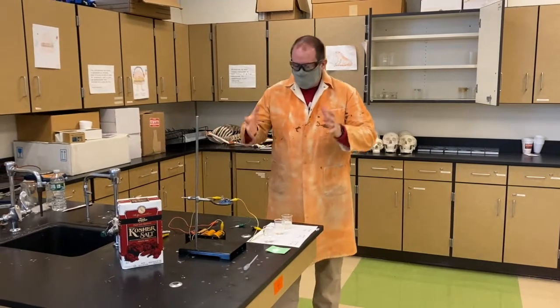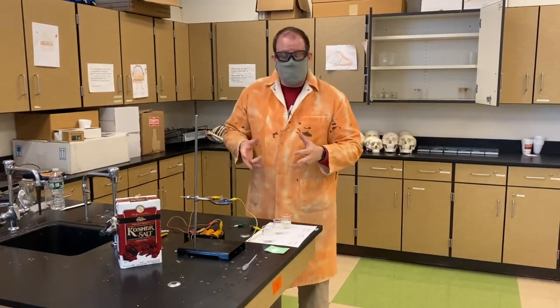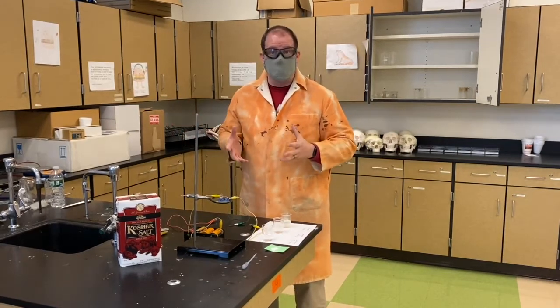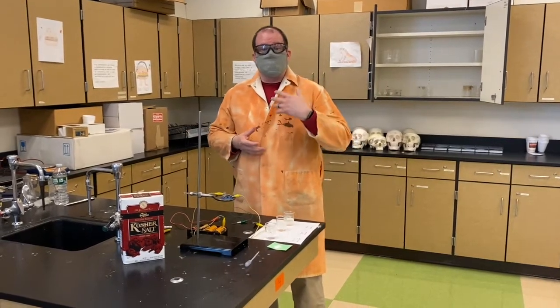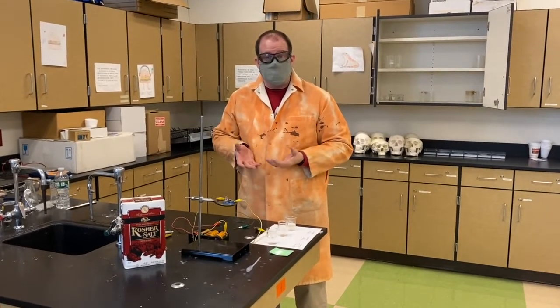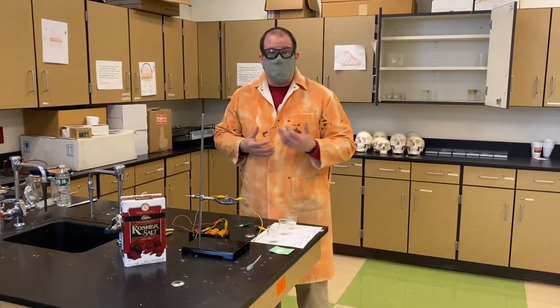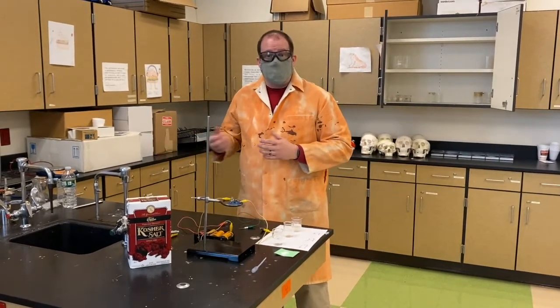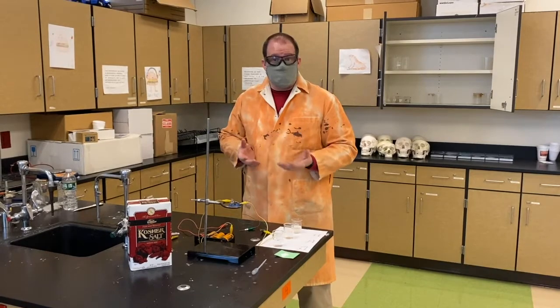Welcome. Today's lab, we're going to be studying the properties of ionic versus molecular compounds. Specifically, you guys are going to be running some various tests. So we wanted to highlight one of the tests here, one of the properties that we notice is very unique to ionic compounds and very different from molecular compounds. And it's the ability to conduct electricity.